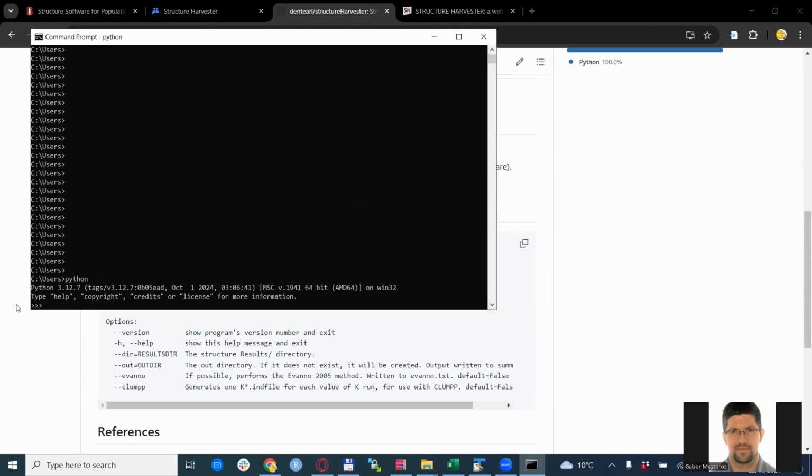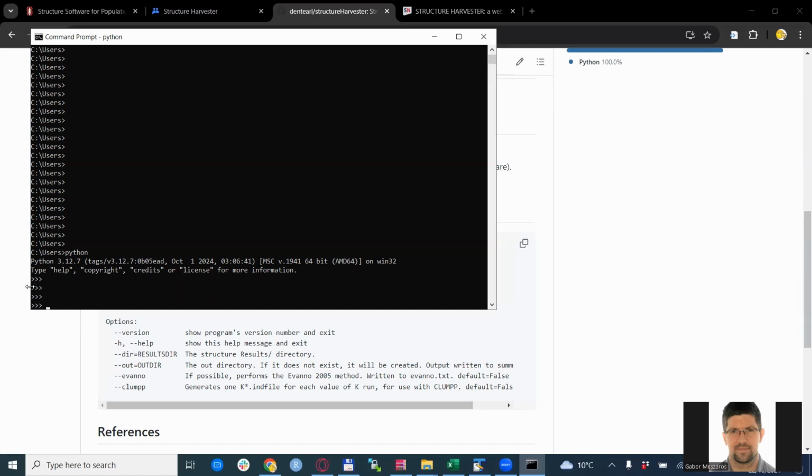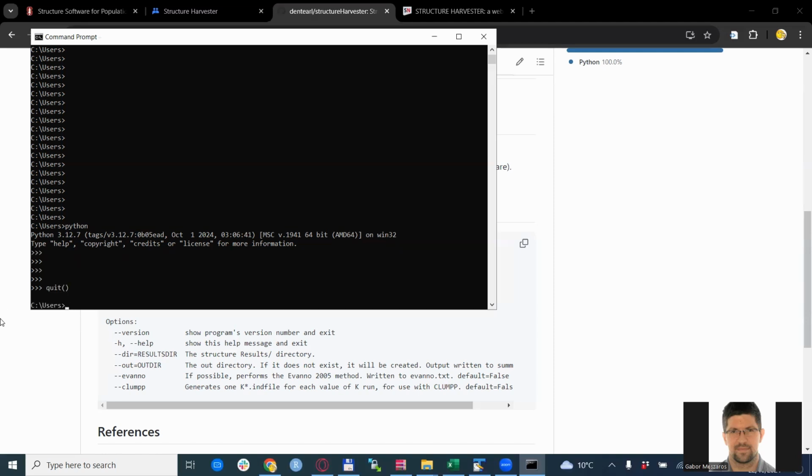If it comes back with an error message or something other than Python 3, then you need to install that first. If you get something like this, so that the command prompt switches into a Python console, then you are good to go. If you get stuck in the Python console, as I did a few times, the way to exit is to write quit and open and close brackets, and then you get back to the normal command prompt. You will use the Python script directly, so you don't need to actually enter Python to do anything.